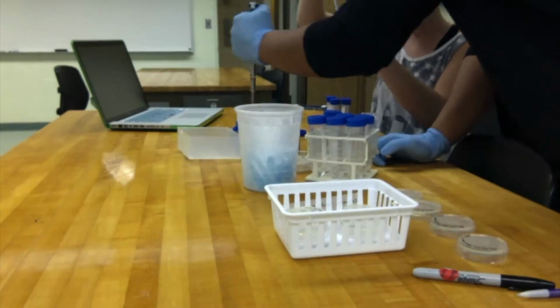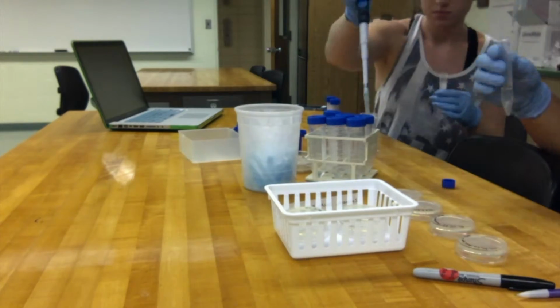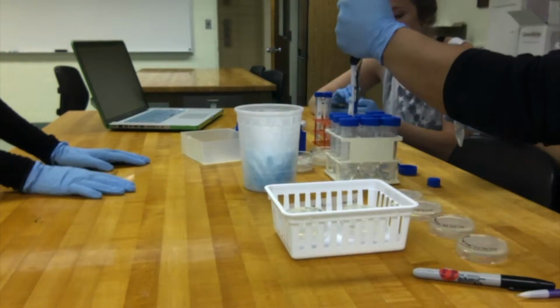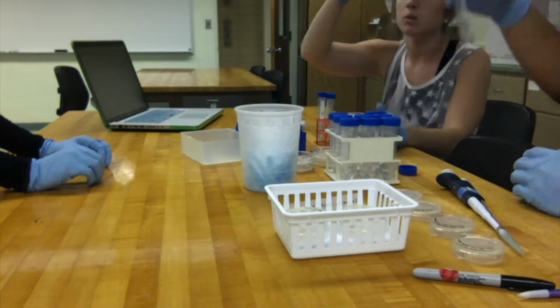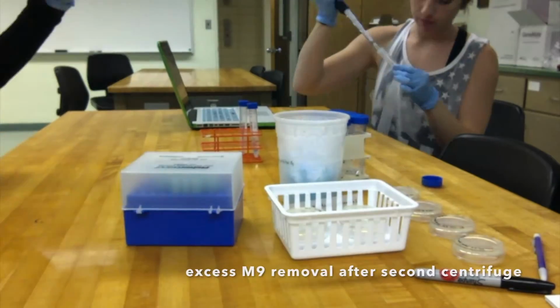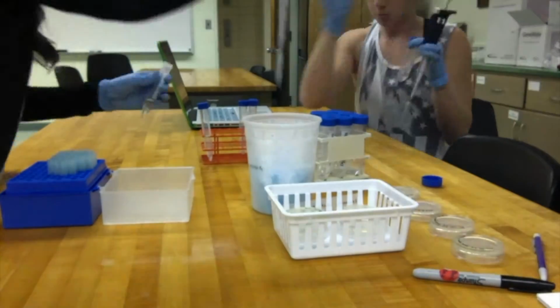Then, excess M9 buffer was removed to a final volume of approximately 200 microliters. After the removal of the buffer, the worms were then washed again in 1 milliliter of M9 buffer, centrifuged, and excess M9 was removed. The repeated washing was to ensure the removal of any remaining bacteria. The tube was then resuspended in order to obtain a homogeneous mixture.